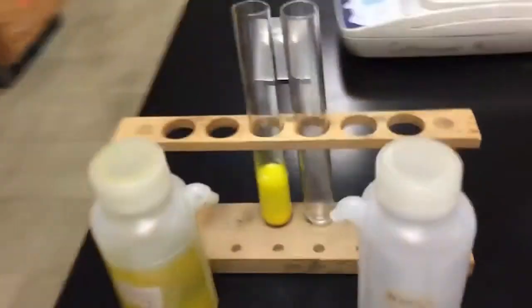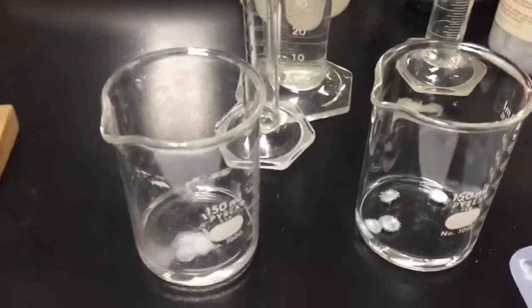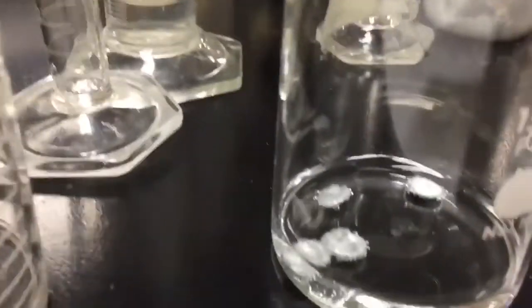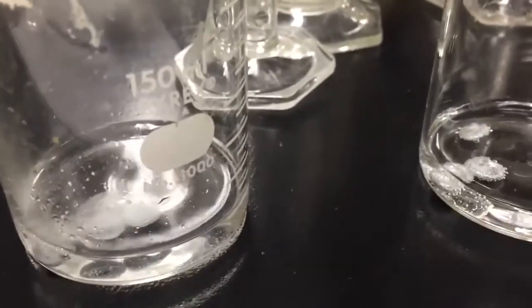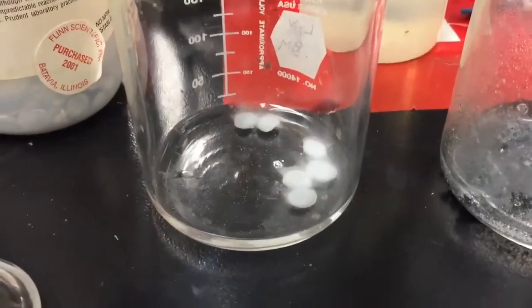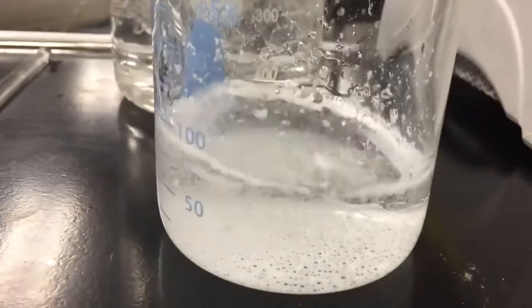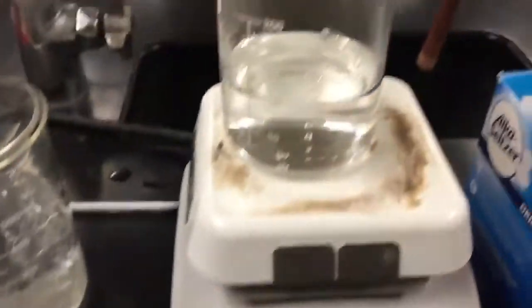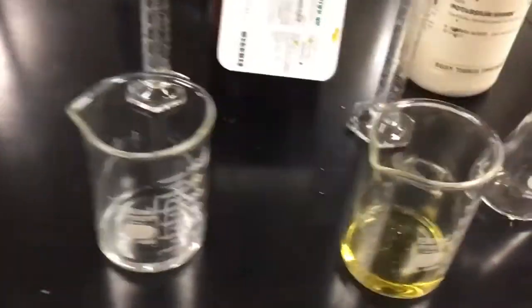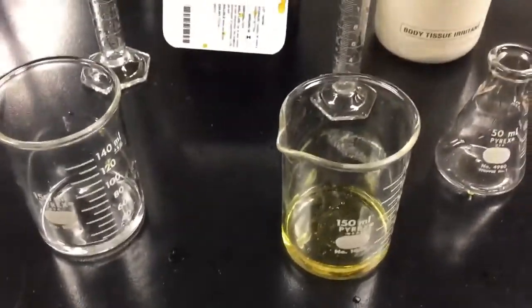Okay? So we've talked about several things. We've talked about the nature of reactants. Talked about concentration. Remember 6 molar hydrochloric acid and 0.6 molar hydrochloric acid. You can see the relative rates there. We talked about surface area, and so we had zinc powder and the zinc ingots. And then temperature. Looks like this Alka-Seltzer tablet might finally be dissolved. This one has long been dissolved. We then talked about the use of a catalyst in lowering the activation energy of a reaction.